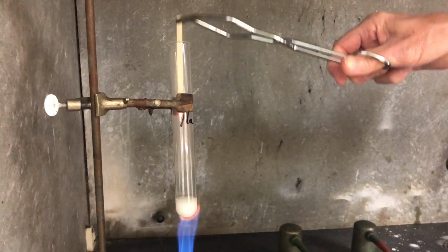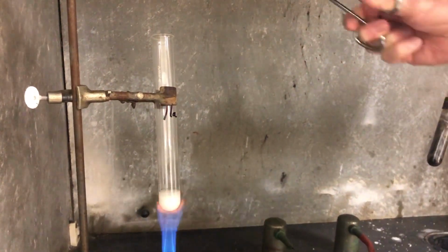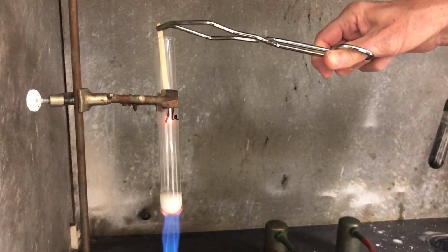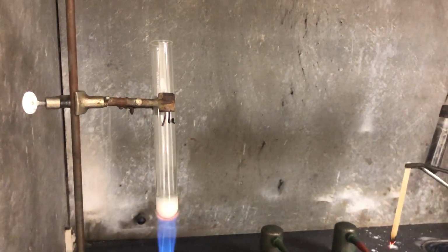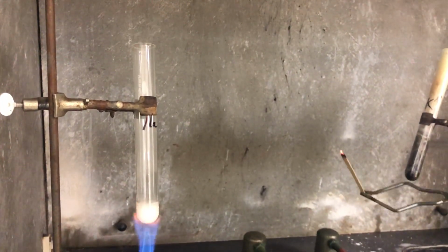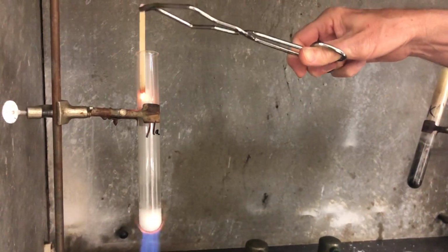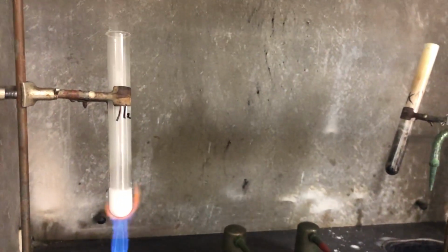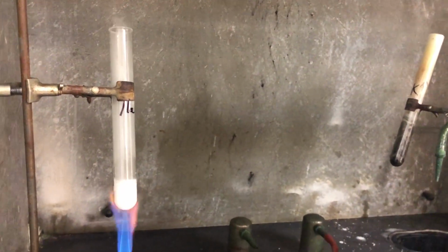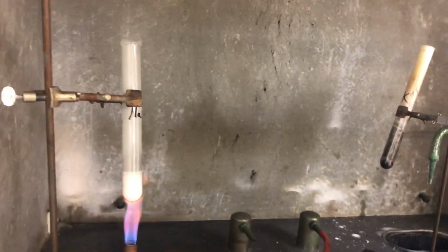You see it glowing pretty well. Now, if this was just the regular atmosphere, you see how it dulls down when you get out into the room, presence of the same amount of oxygen. Now, if we go down there again, you can see there it burst into flames again. See, do it again. All right, so we're predicting the same thing. So let's see what happens.